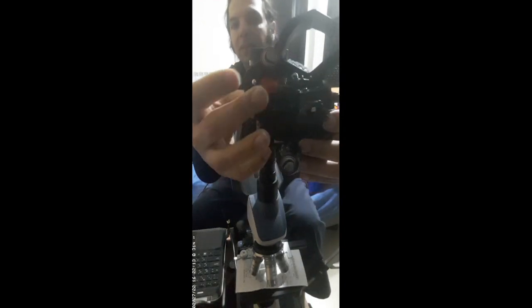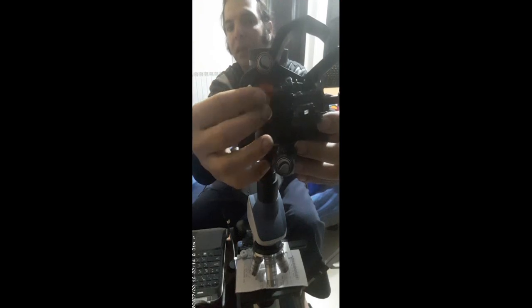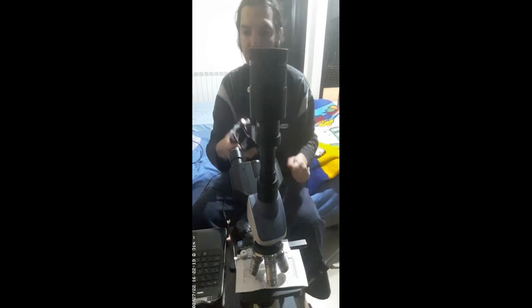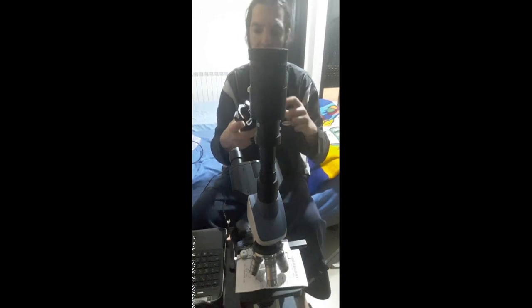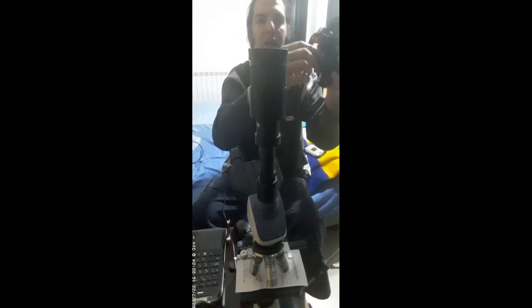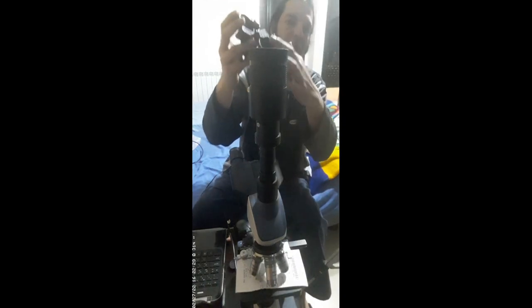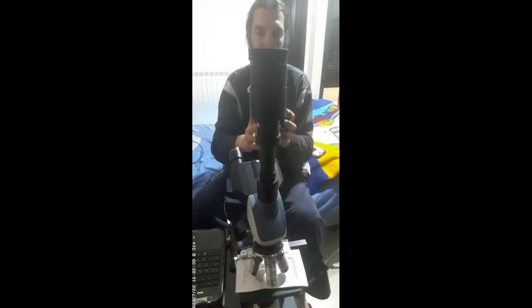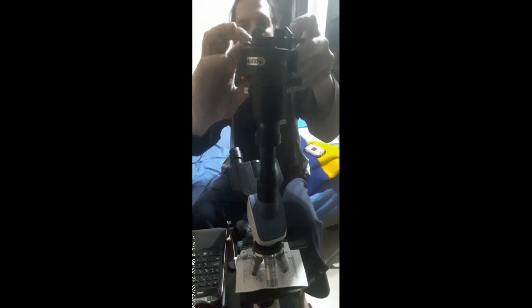This is what fastens here. I put my phone. I'm currently using the phone to record. Also these buttons here are just to move the plate holding the microscope, holding the telephone. This plate. Those knobs, those buttons, are to move the phone and align it in its proper place. This way we can take a picture. Let's raise it a little bit. Fasten it very well, screw it firmly.